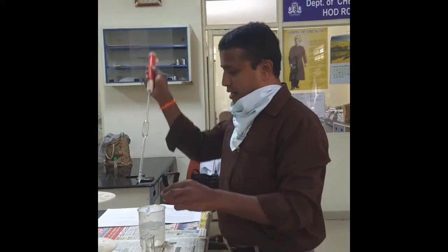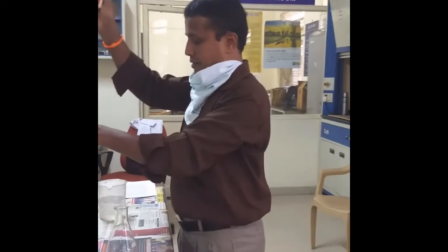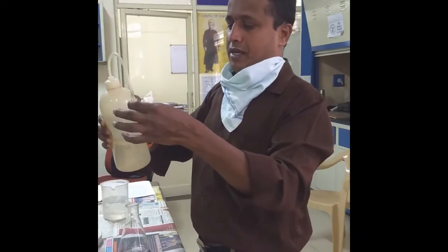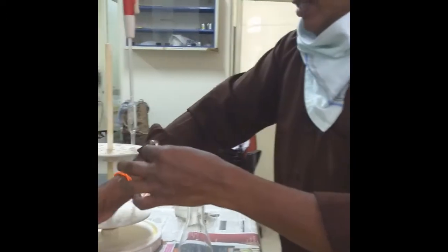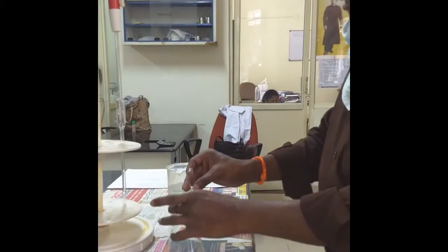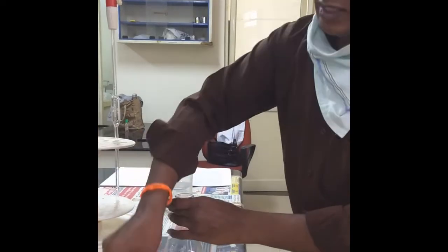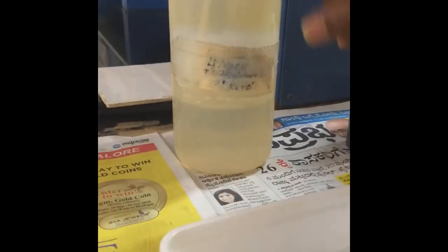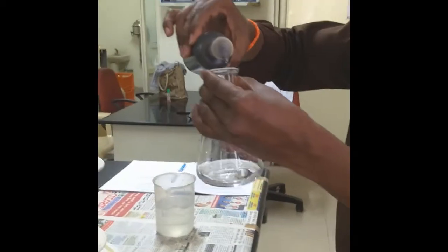Now I have pipetted out 25 ml of cement solution into the flask. Then you need to add one test tube of a reagent containing 4 normal sodium hydroxide, 1:1 glycerol, and diethylamine. All three reagents are combined into one solution — a blend of sodium hydroxide (4N), diethylamine, and 1:1 glycerol — and that one test tube I am adding. Then you need to add three to four drops of Patton and Reeder indicator.